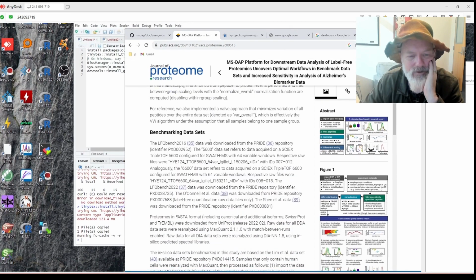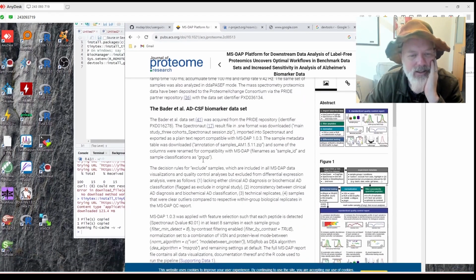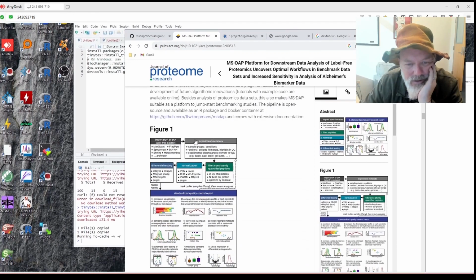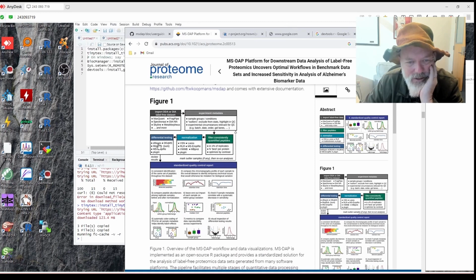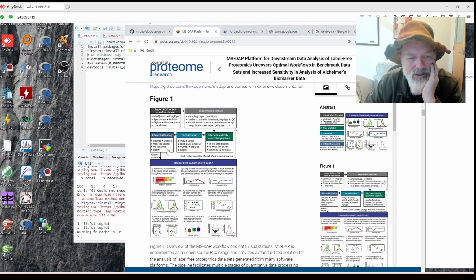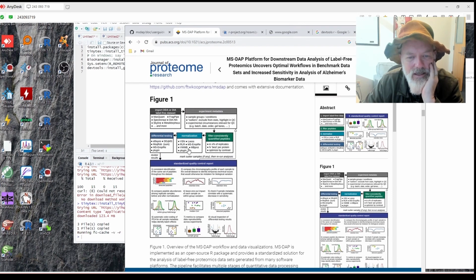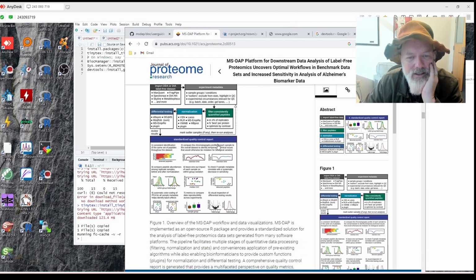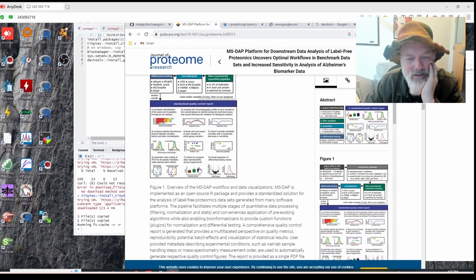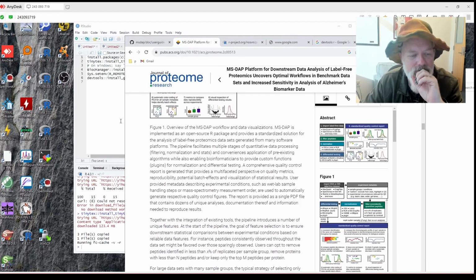This does multiple differential expression packages. Let's see, it does differential testing using eBayes, DEqMS, MSqRob. I don't know a lot about these. Does normalization after it filters the peptides. It does a bunch of reports. So let's see how it works.